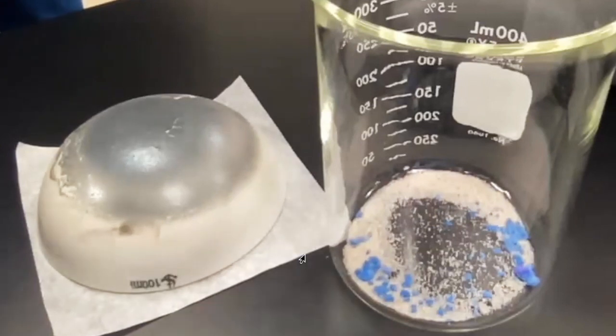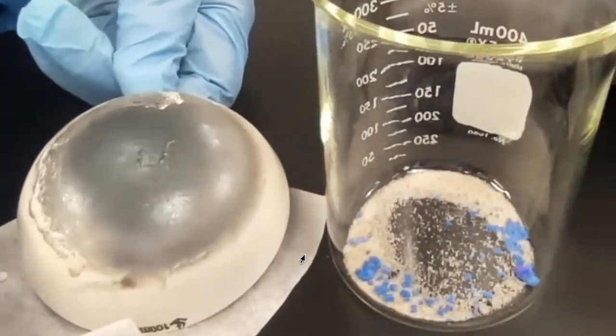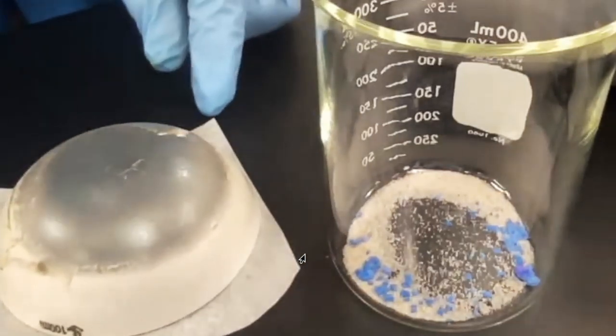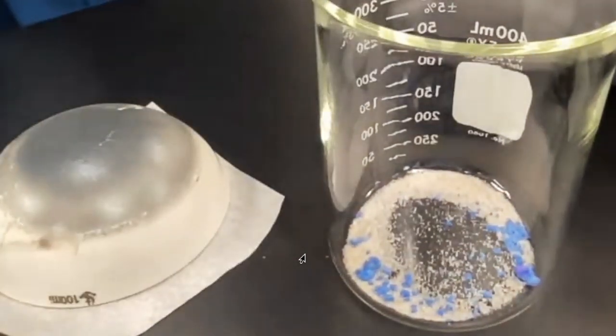You know what that is. I don't have to tell you. But look at this powder blue, and then look at this chemical right here. This is A. Okay. Once you're done with A, then just kind of put it aside. Don't let anybody touch it. Put it aside. You want to take a picture, I think, of the 3 isolated substances at the end. So put this aside. You don't need the evaporating dish anymore.